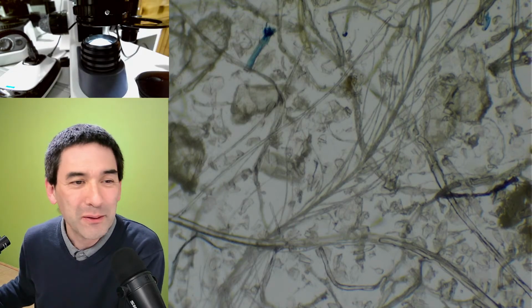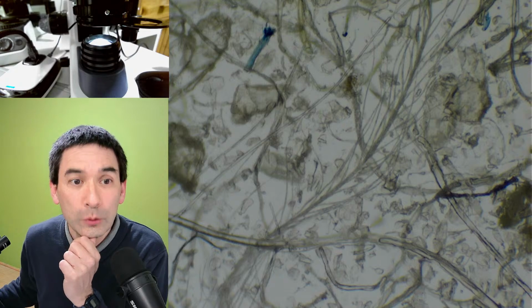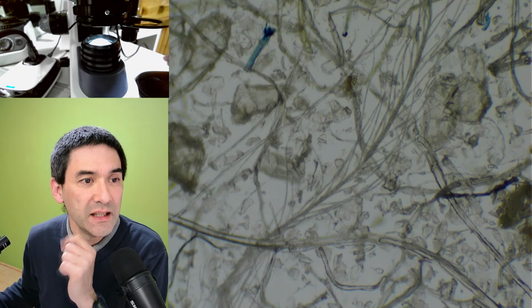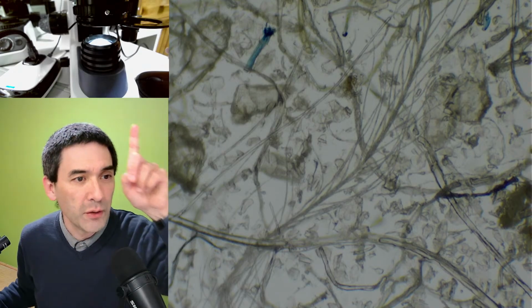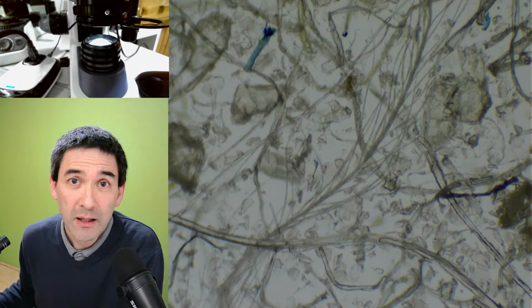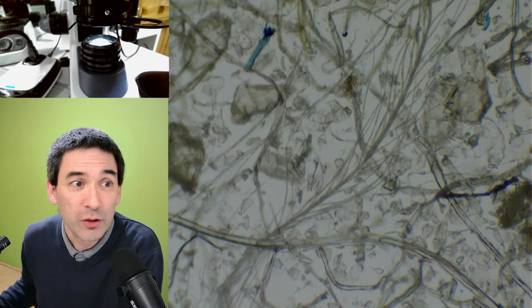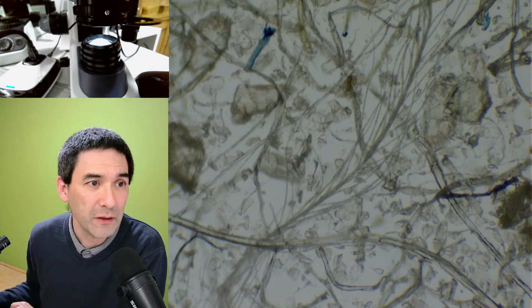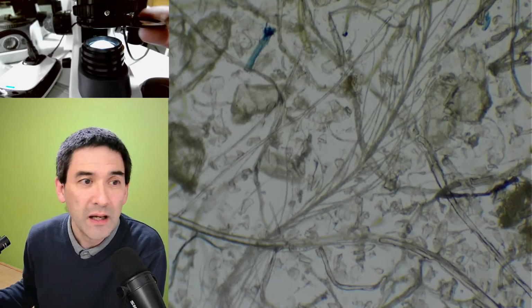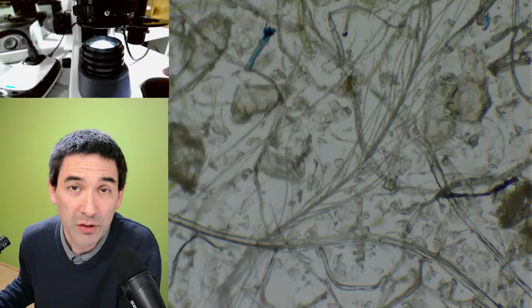Today's video is about a lighting technique called oblique illumination, and I would like to show that to you. You can see that the setup is a little bit different. It's a different microscope that I'm now using. It's not the DIC microscope, but a standard bright field microscope, and there's also a filter holder here that I'm able to use. I just want to show you what oblique lighting is, and we're going to take it from there.